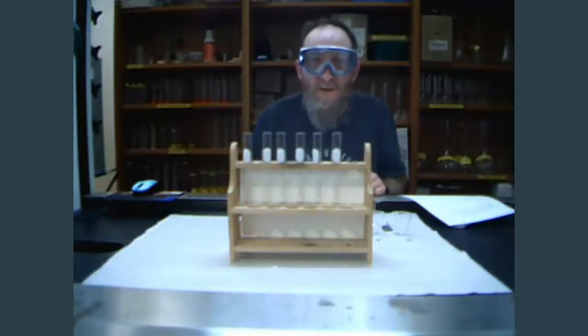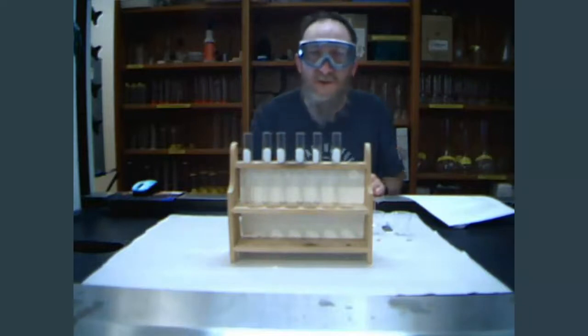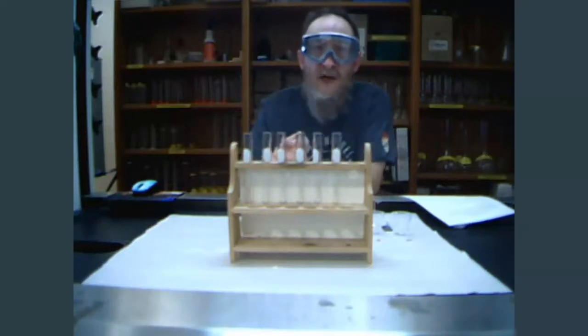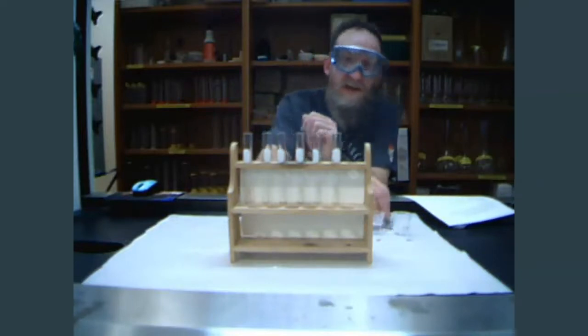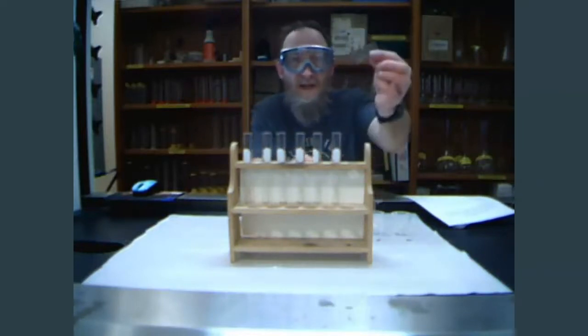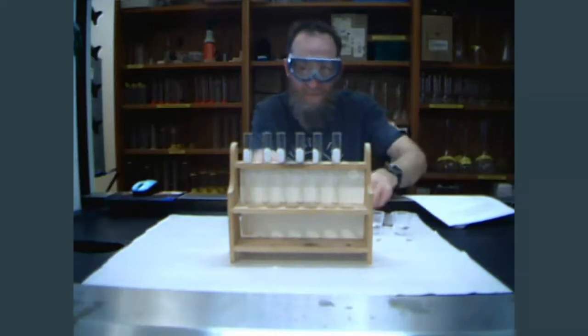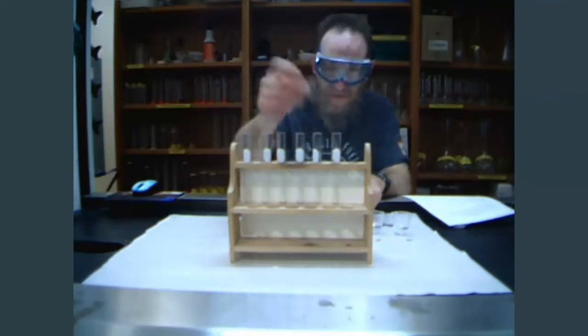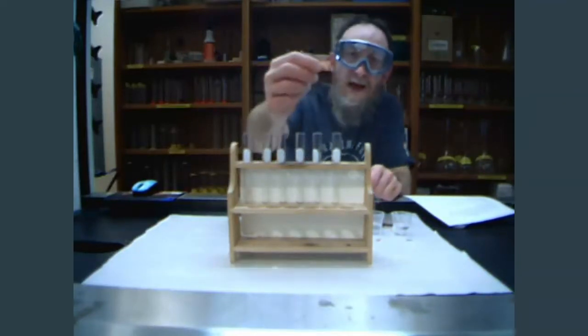Welcome back to another Kicked Up Chemistry. Today we're going to do an experiment in which we're going to investigate the properties of metals. In particular, we're going to study the interaction between lead, zinc, and copper.